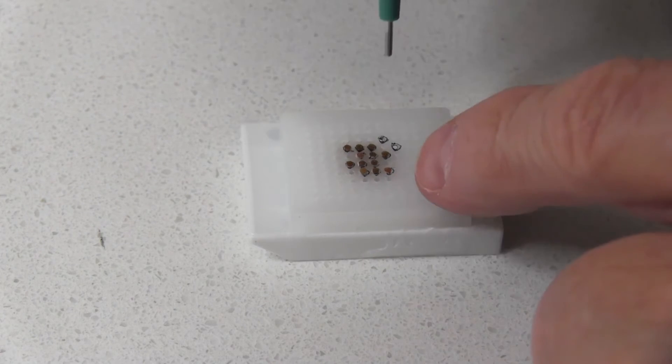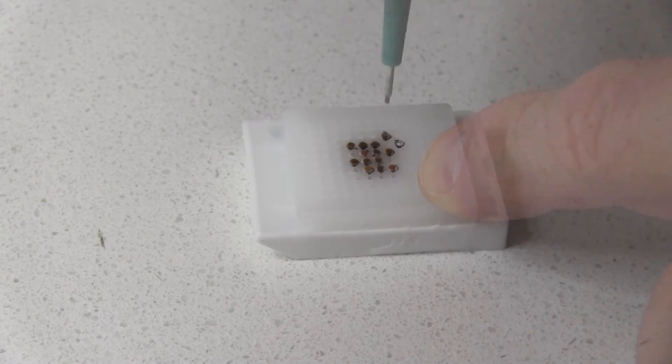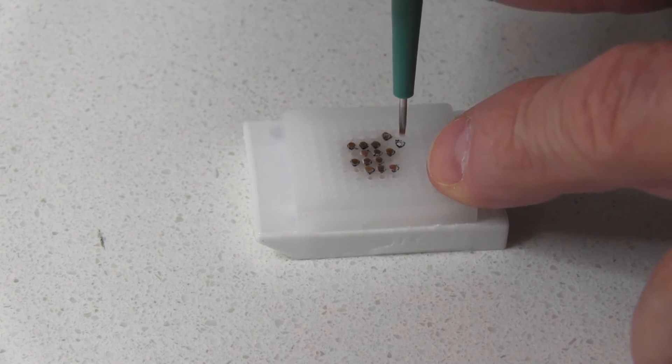Now for the control spots. Now I'm finished with the TMA construction part.